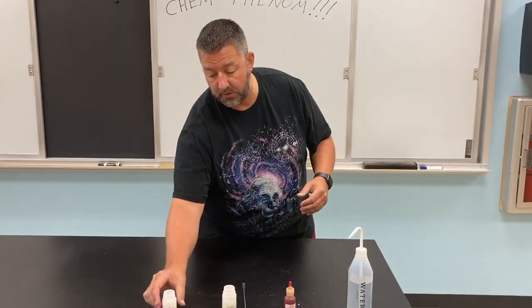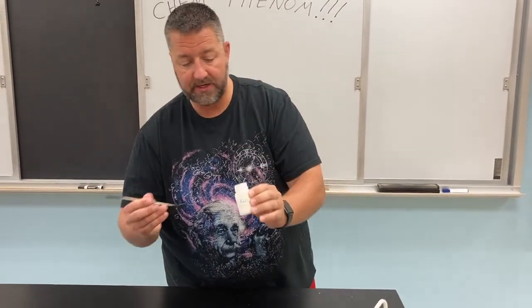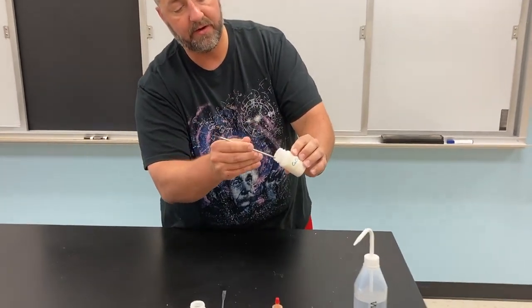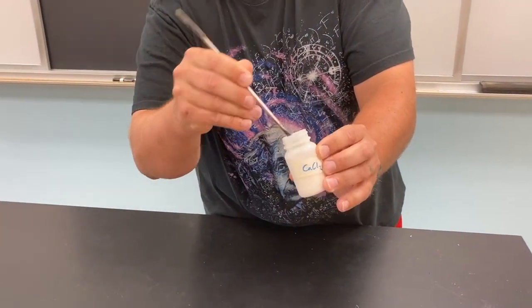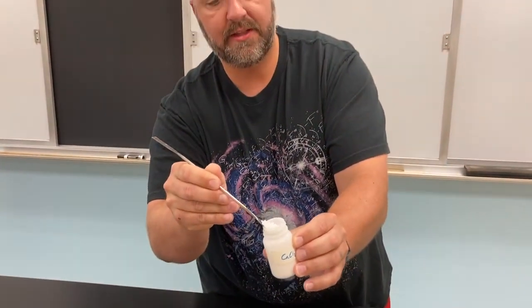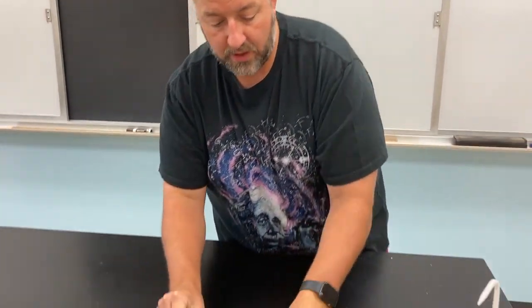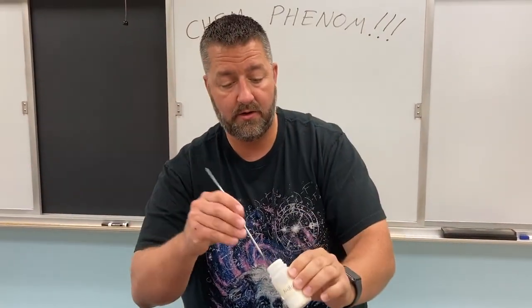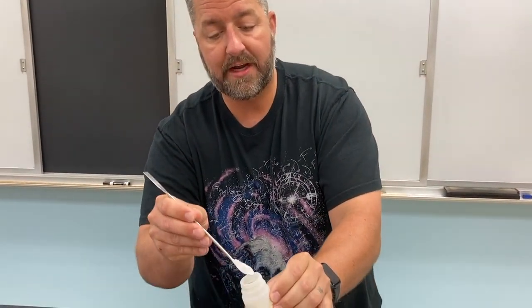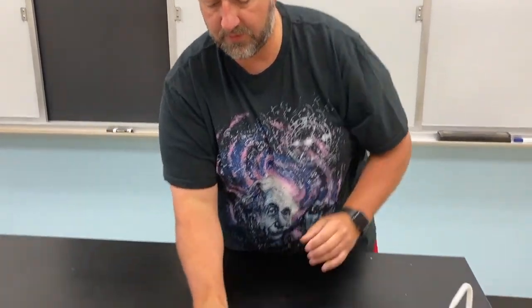Now, the chemicals we're going to use are calcium chloride, CaCl2, and if you look at this, Mr. Van Grandel, calcium chloride is a white solid. It comes in tiny little particles like that. Okay, so it's large crystals, white solid. We also have sodium bicarbonate. You might know it as baking soda. It's also a white solid, but it's a fine powder. Okay, so we have two white solids, different substances.